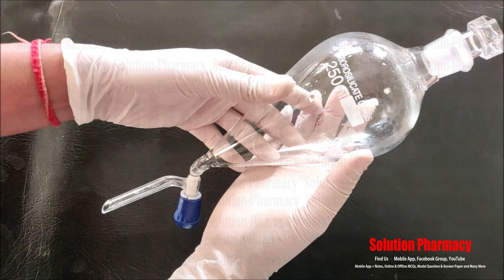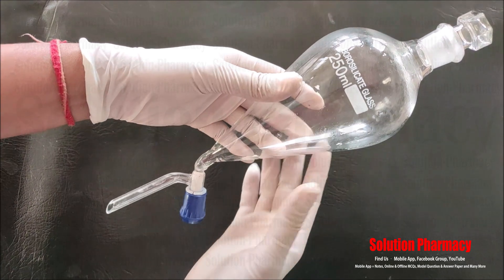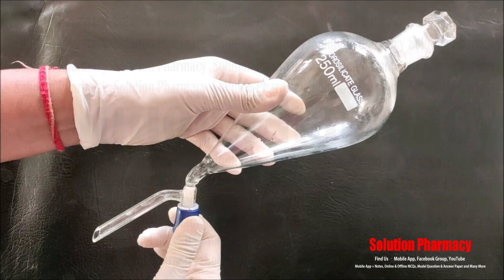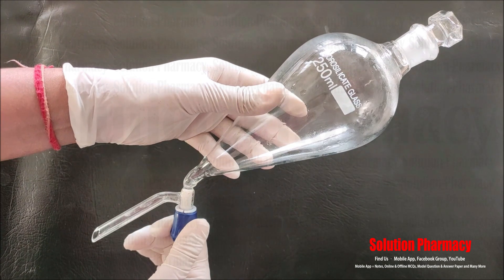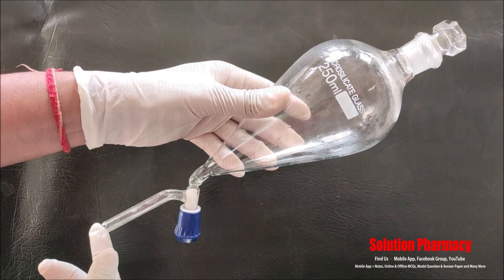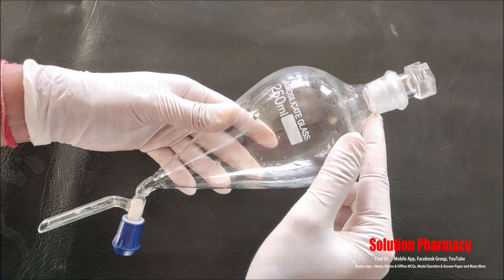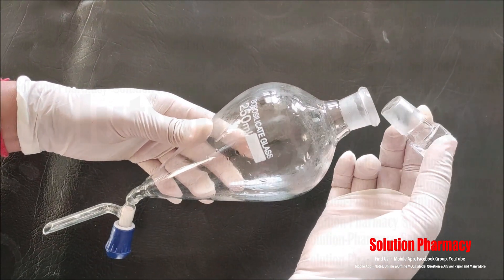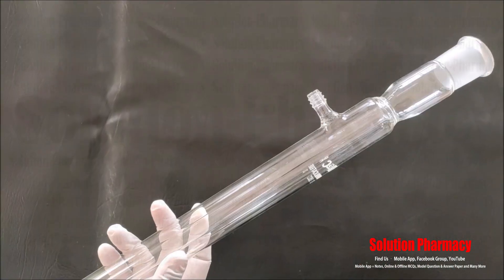For example, to separate an oil and water mixture, we use this separating funnel. When we add the immiscible liquid mixture, we observe two different layers. There is a knob that we can open and close — the lighter liquid floats on top and the heavier liquid remains at the bottom. When we open the knob, the lower liquid separates out first; then we close the knob and open it again to collect the other layer in a separate container. A stopper at the top must be tightly closed while shaking the liquid mixture.